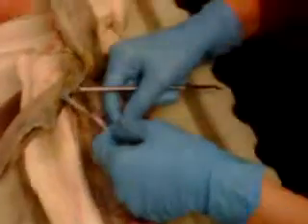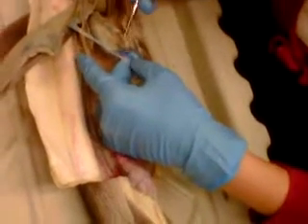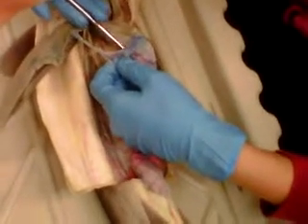This is the pancreomesenteric vein. This one right here is the lobe of the pancreas, but underneath it is the lienomesenteric vein, which will run right along the dorsal of the pancreas. And this is the gastric vein that runs next to the gastric artery.